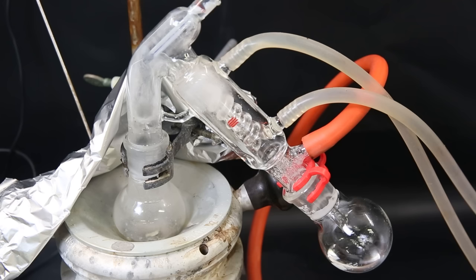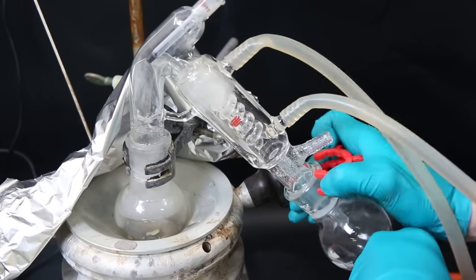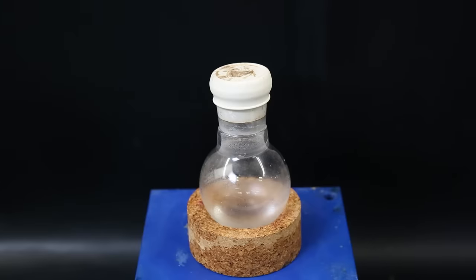Any tin metal, tin 4 chloride hydrate or tin 2 chloride will stay behind in the flask, and the chlorine will get kicked out. When the distillation is finished, I am left with some clear tin 4 chloride, in a disappointing yield of about 20%.